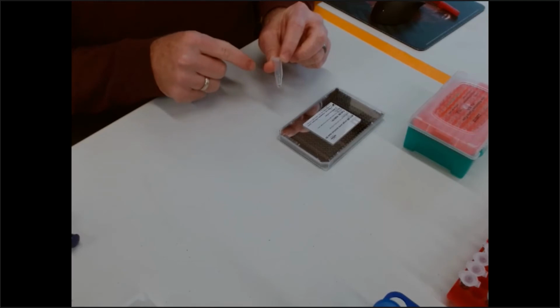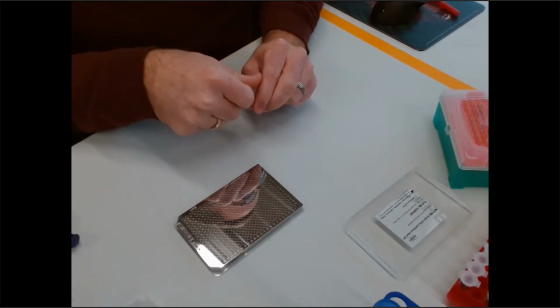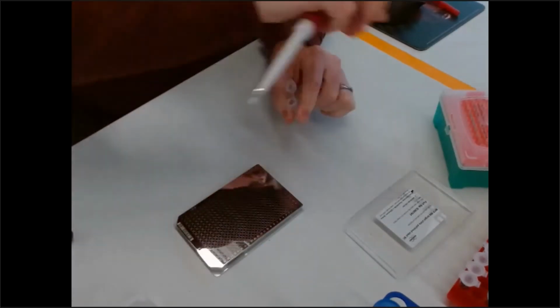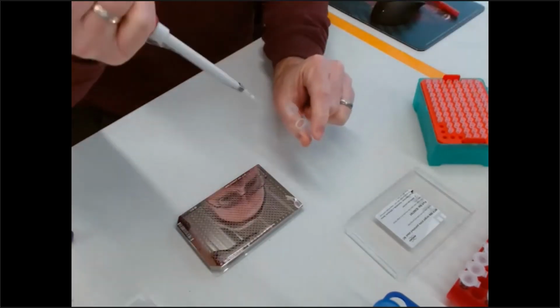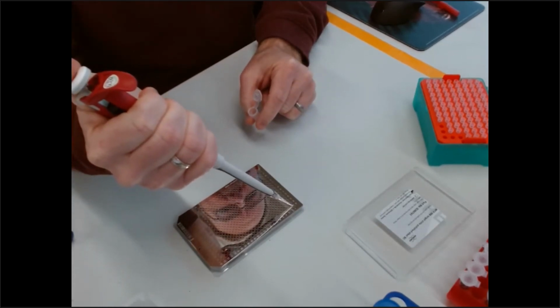This is a pre-mixed ratio of matrix and analyte, but I will demonstrate how this is applied to a target and how simple this can be. So now we have the mixed ratios, and I'm going to take my pipette tip here and very quickly take a very small quantity, 0.5 microliters, and place that on this well in well A1.